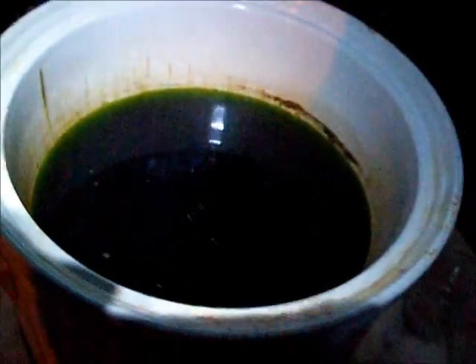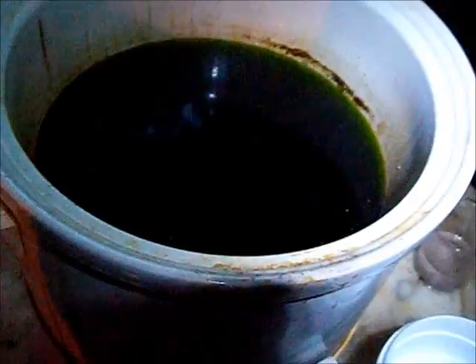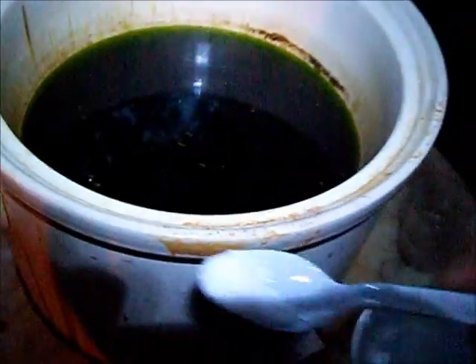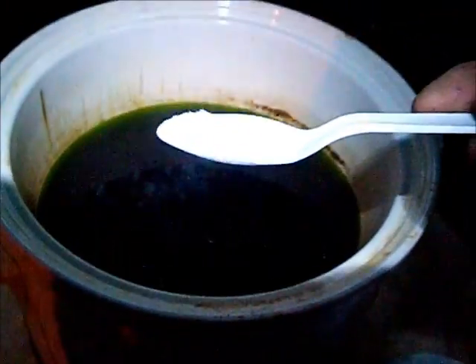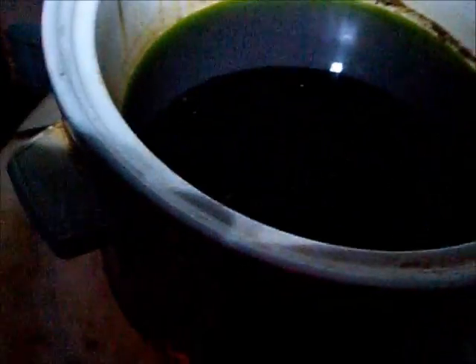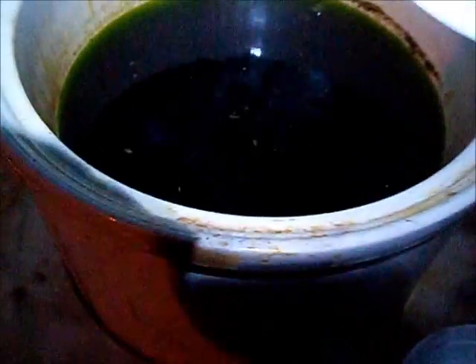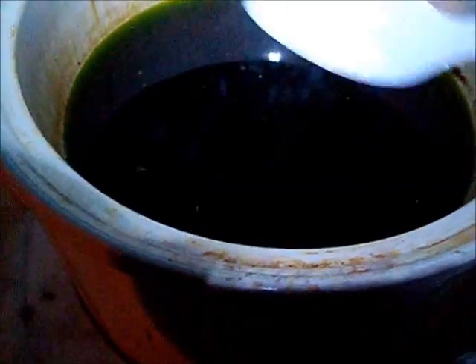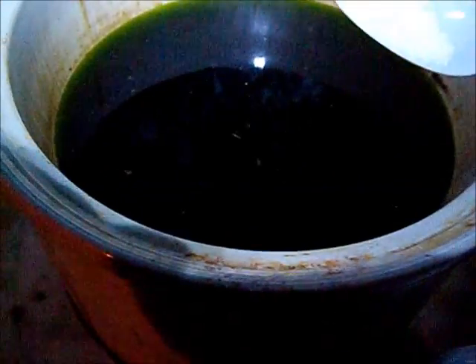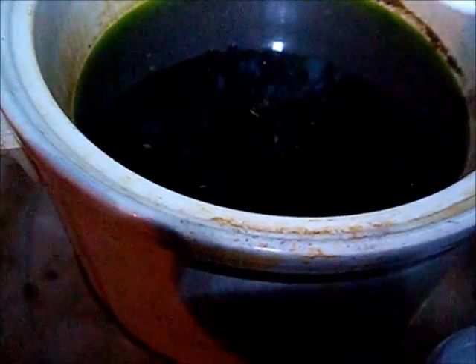I bought this from Lowe's, and I'm just going to put some in here dry. I just got not quite a half a teaspoon, just a little on a spoon. Because I don't know how much nitric acid is in here — this is processors — and I have no idea how much nitric was actually needed, because this is the third dissolution.